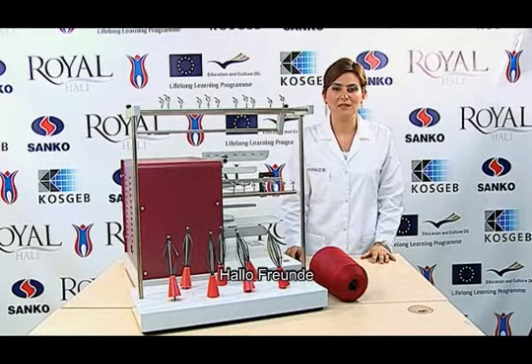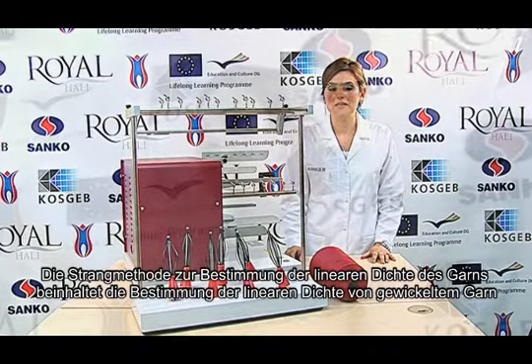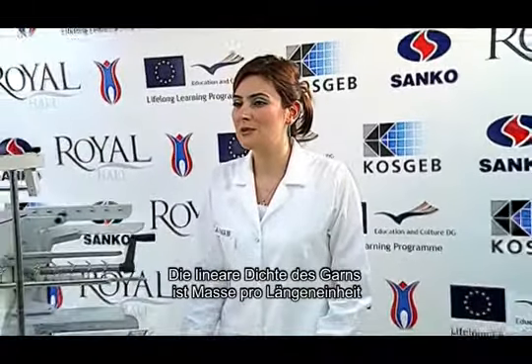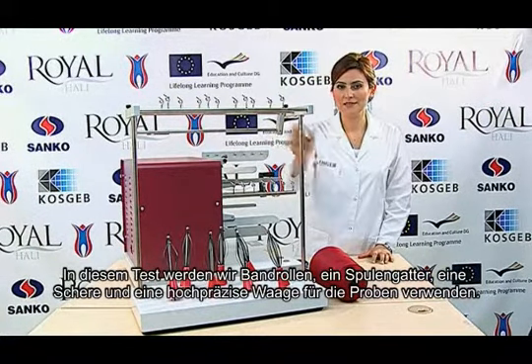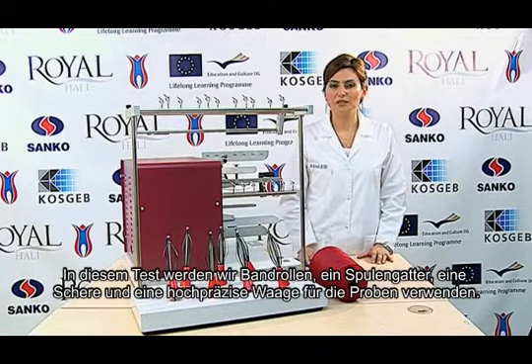Hi friends! The skein method, which is used to determine the yarn's linear density, covers determining the linear density of wound yarns. The yarn's linear density is its mass per unit length. In this test, we are going to use reels, a creel, scissors, and a precise balance for the samples that we take.